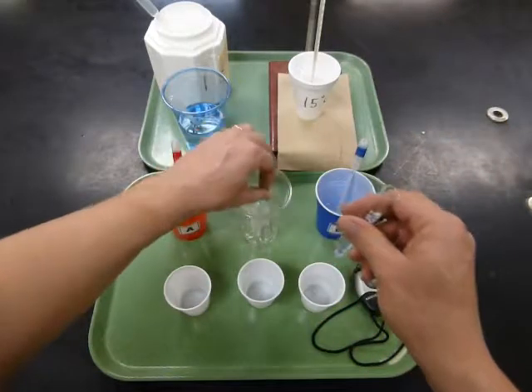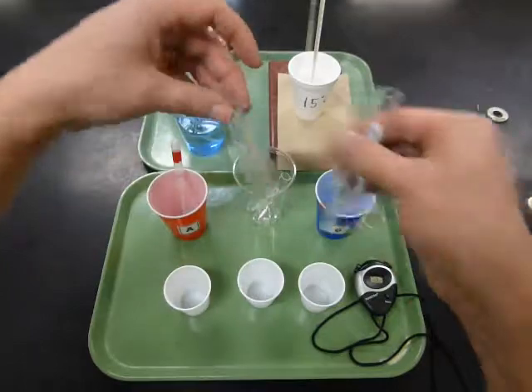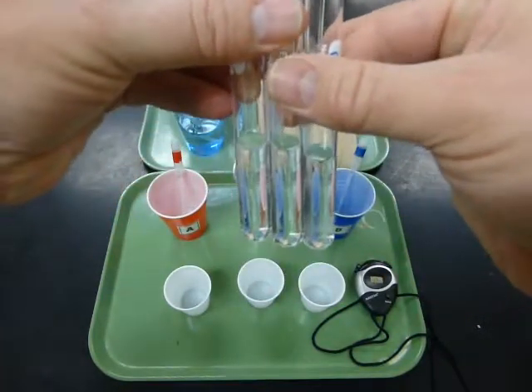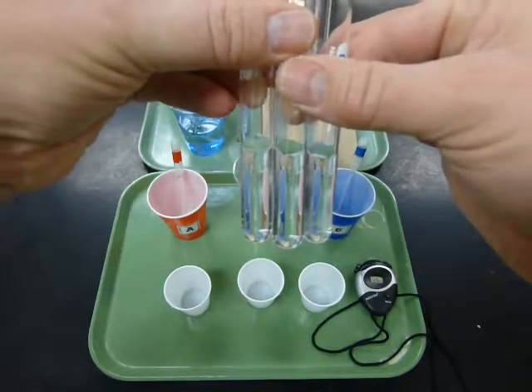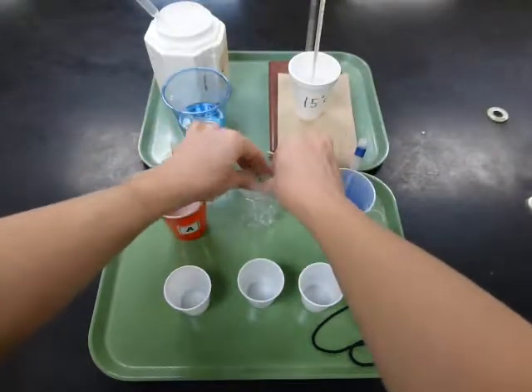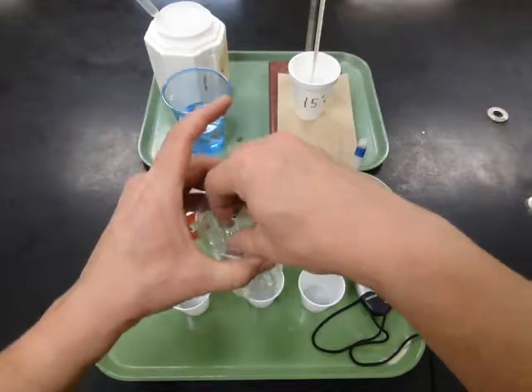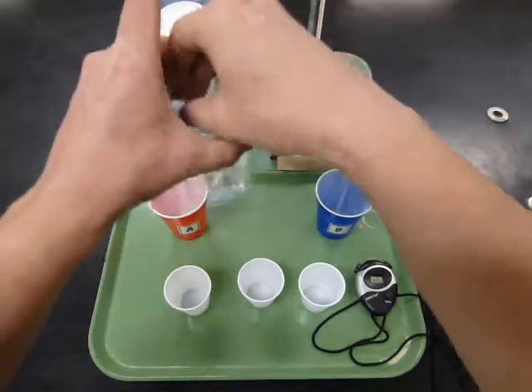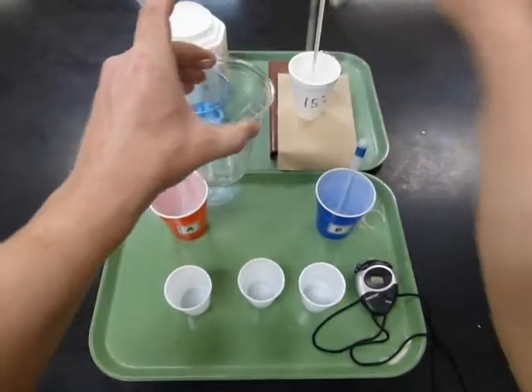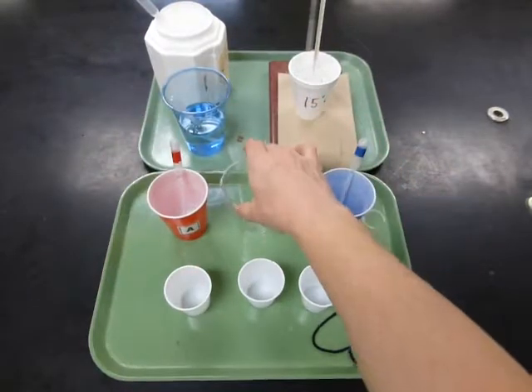tube. You know that you set it up right when you look at the tubes. They should all have the same volume, 5 milliliters. So look to see that when you put them together, the volumes are all the same. We don't want to have any differences in volumes because we know that that changes the reaction rate. Once you set up 3 tubes of A and 3 tubes of B, take all of your tubes and put them in your cold water and let them sit in the cold water for about 3 to 5 minutes so that they get down to the temperature. And of course, someone is keeping track to make sure that temperature stays constant.